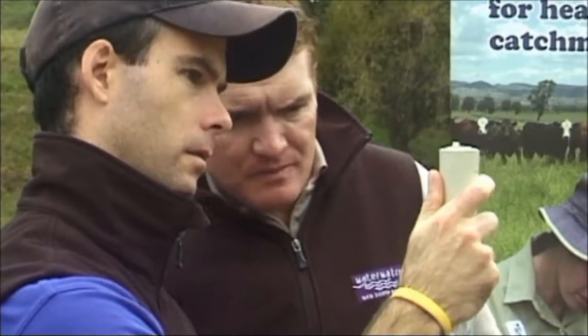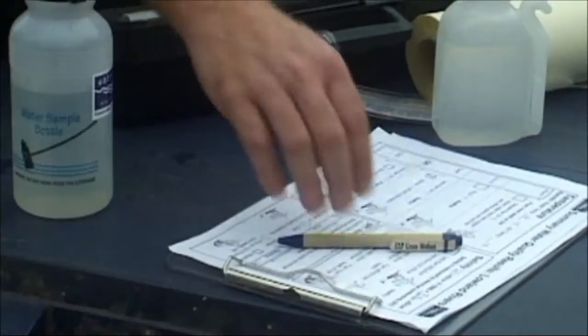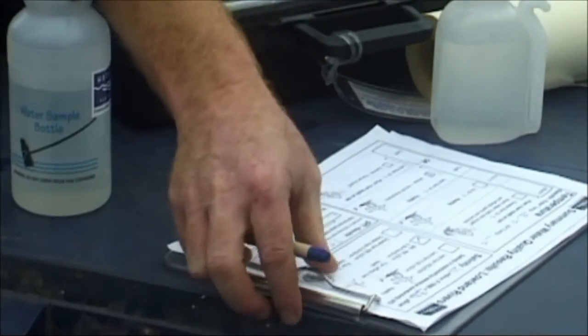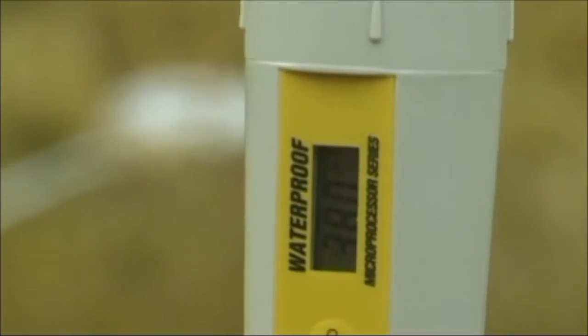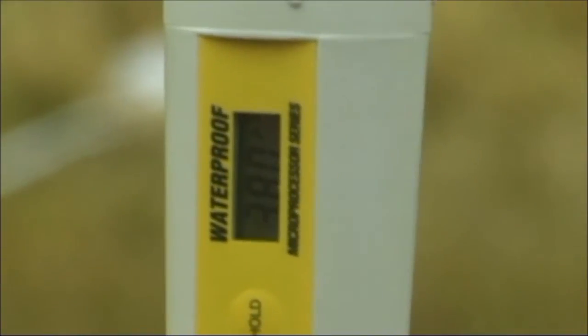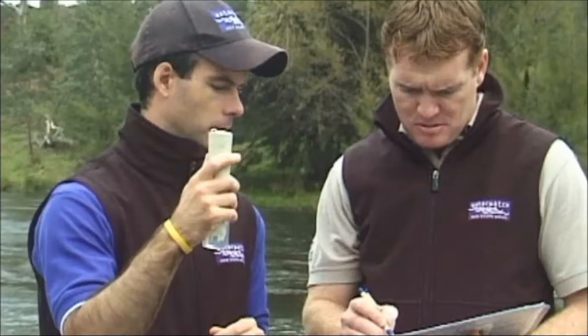Hold the meter in the sample water and rotate your wrist. Allow time for the number value on the display to stabilize. Record your result.